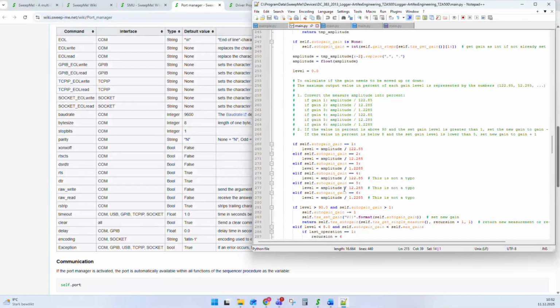And this has also an advantage, that you can use this driver in your own Python projects and can directly access these single communication commands. So we want to give our drivers a double use: on the one side, we have a connection to SweepMe using the semantic functions, but we can also populate drivers with wrapped communication commands to use them in individual projects, to make the driver better readable and understandable.